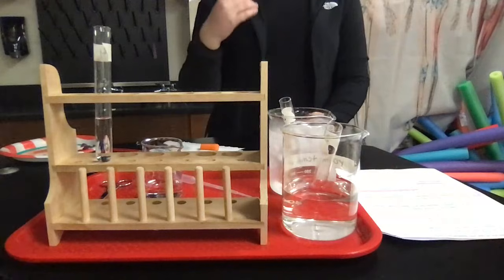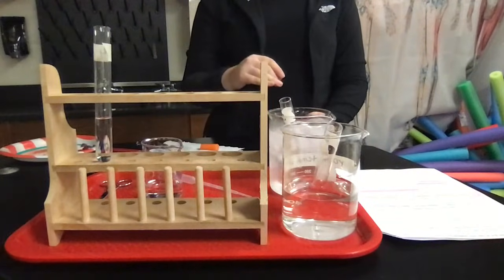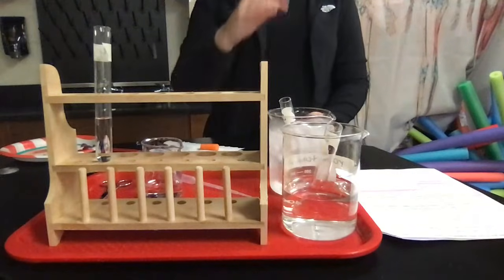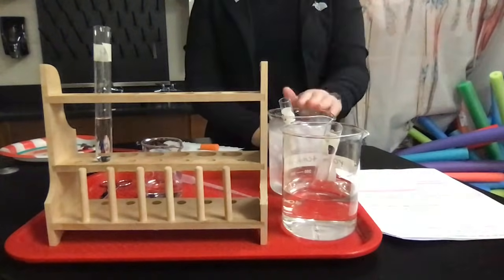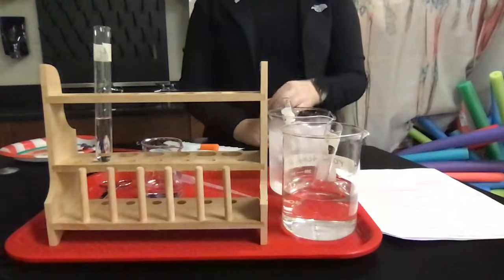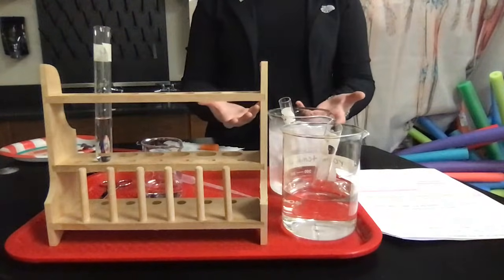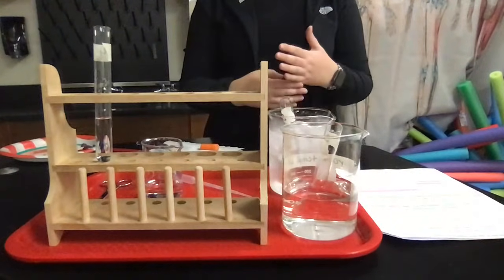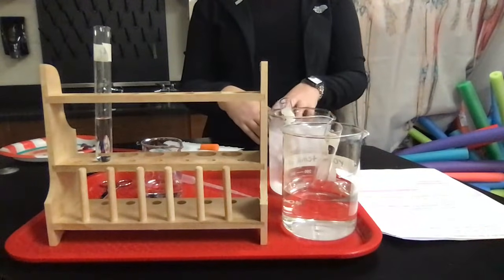So the first thing that I needed to do for this was to put my test tubes full of hydrogen peroxide into different environments. I have a room temperature tube. I have a hot water bath tube. I have an ice bath. And then I also have a piece of liver that was boiled for 10 minutes. And we're going to see how that affects the overall process. So we're going to treat the hydrogen peroxide with different environments to see how temperature is going to affect the rate of the catalysis here.